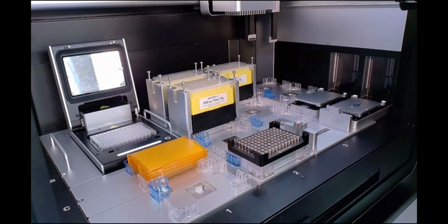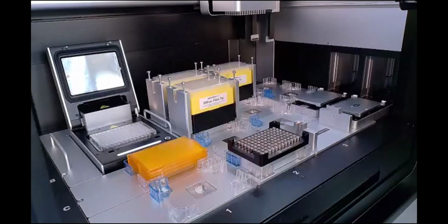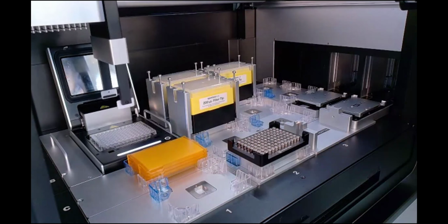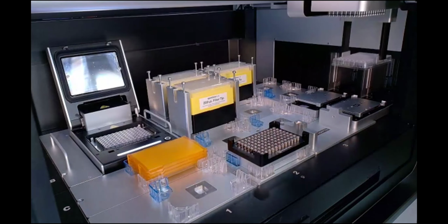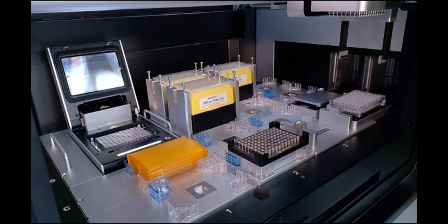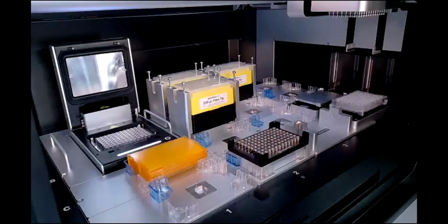the protocol level. So we are super excited to be able to debut the stackers, as well as the auto sealing lids and the lower volume head. All of these are going to be included in the High-Throughput NGS Workstation. The lower volume head is an option. You can still select the higher volume or normal 96 channel head as well. And as a full bundled solution, it is really an enabling feature set to be able to give customers as much walkaway time within our robot as possible.